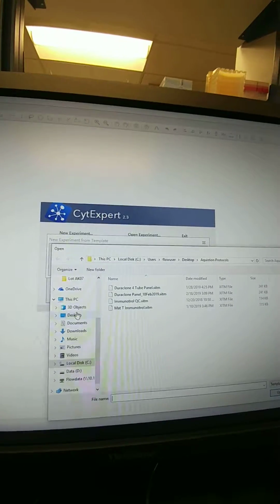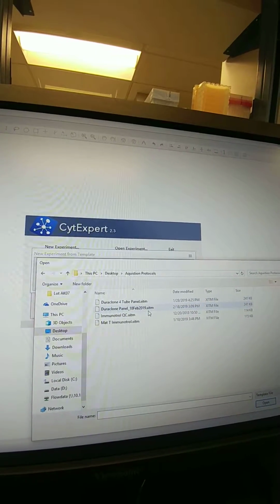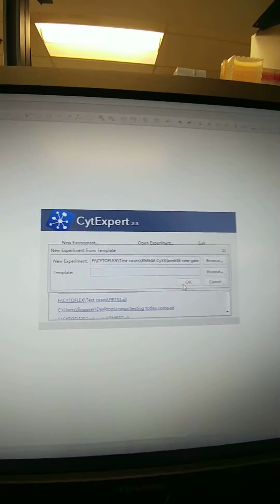Browse, and then I want to get my acquisition protocol. Load my panel.